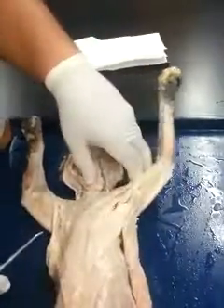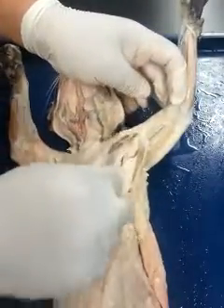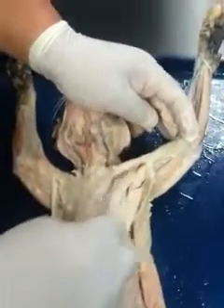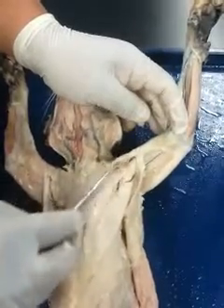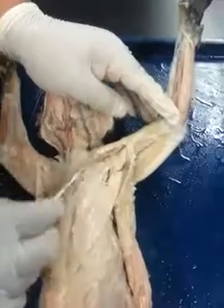Muscles of the superficial chest. Right, so these are going to be 4 muscles that you're going to want to identify here, or at least be aware of. The first one is the pectoralis antebrachialis, right? Only found in cats, not found in humans. So we're not really going to be too concerned about this muscle as far as identifying on the practical.